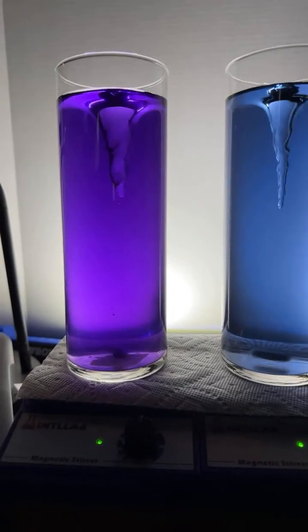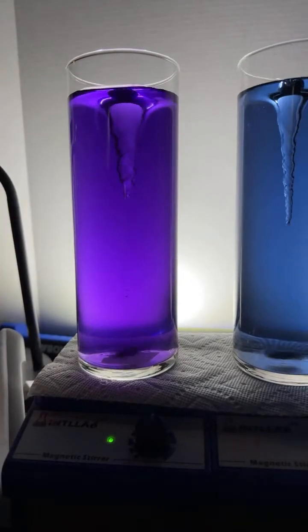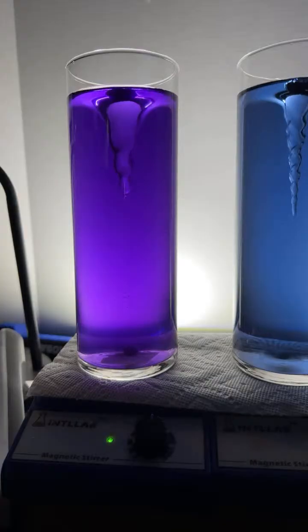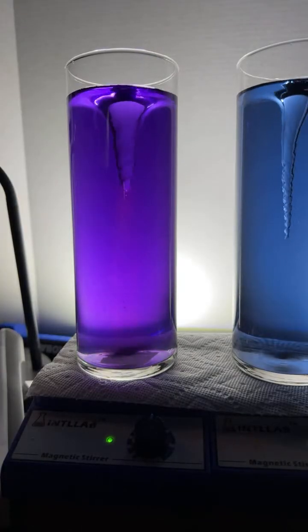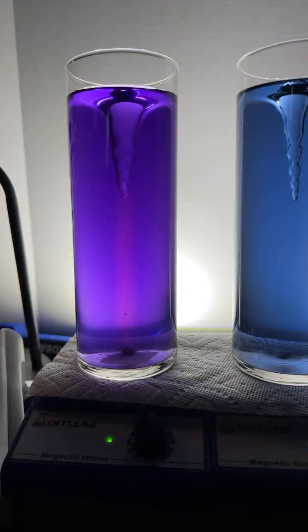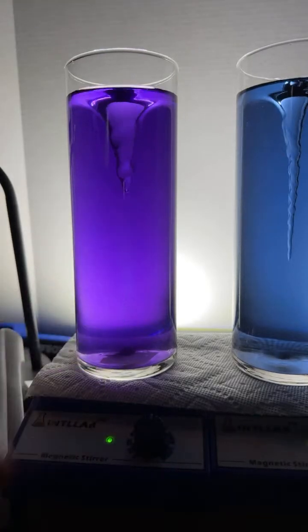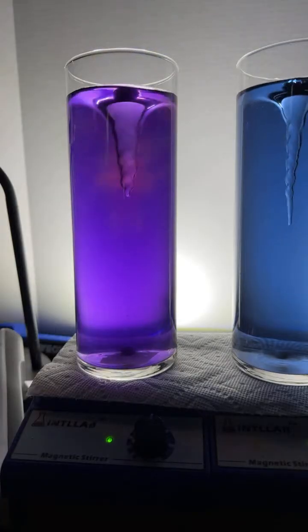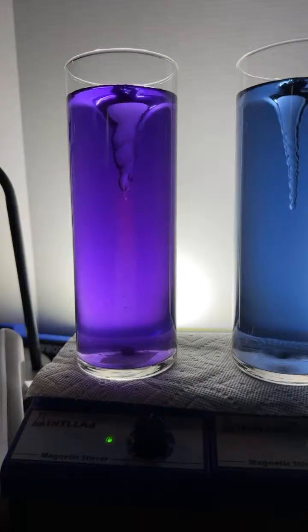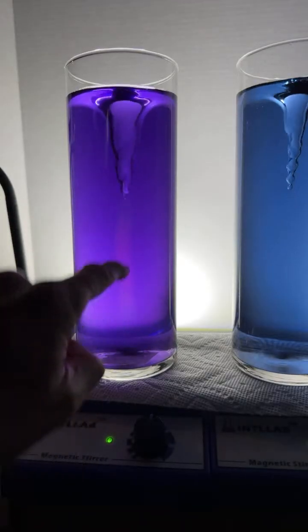So let's do it on this side. Let's do a titration over here. There's an excess of base, and I'm going to start adding hydrochloric acid to it. And we want to try to add the acid until it turns green. I'm going to add 1 drop there. Let's see what happens. You're right, Kyle. There were 4 drops is all it took. You can see in the middle, the acid tends to stay concentrated there. Okay, there was 1 drop. Let's do the second drop. There's a second drop. All right. I think we're going to need another one. I got to wait till all that red stuff disappears.